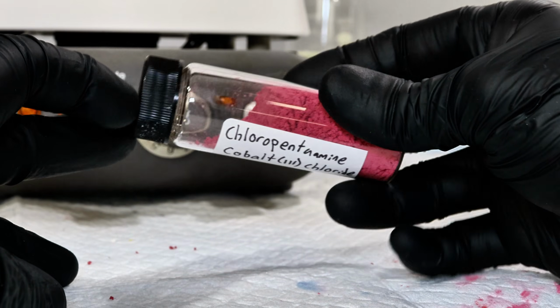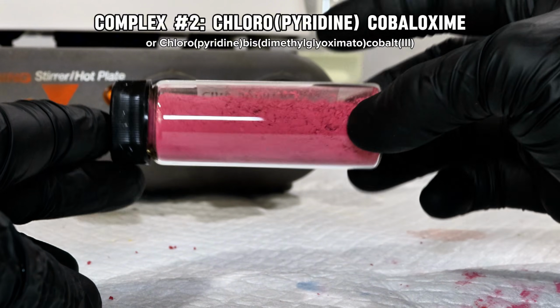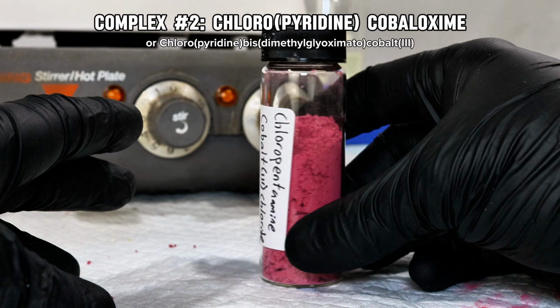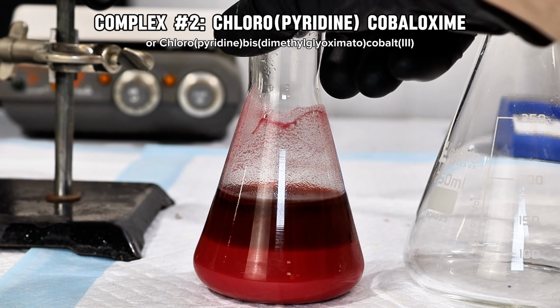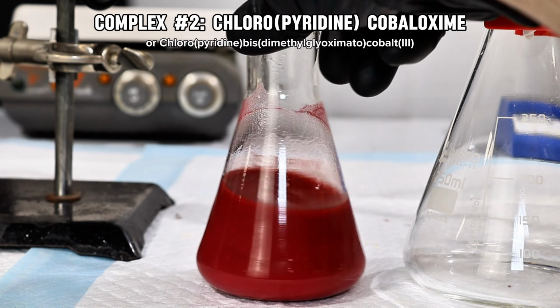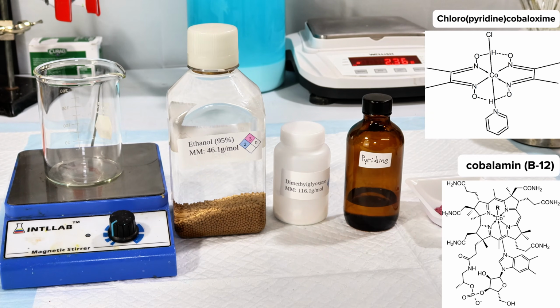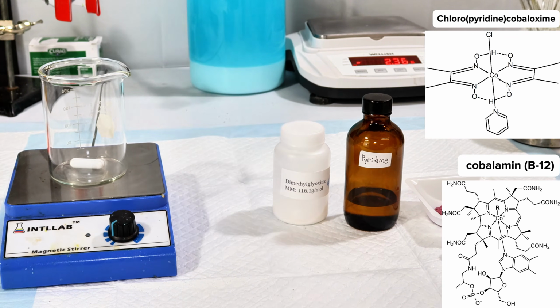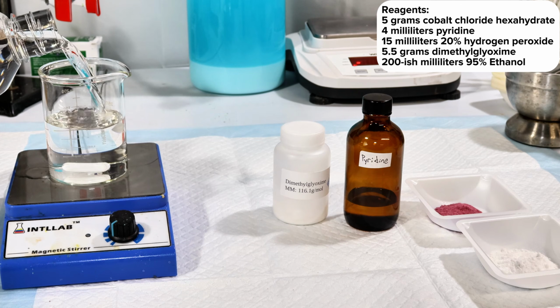Now, the second cobalt complex I'll be making today is called chloropyridine cobaloxime. This cobalt complex is a good example of how a resulting complex can be charge neutral, and will introduce a new kind of ligand. Not only this, but due to its unique structure, this chemical has been considered as a model compound for vitamin B12 for studying the properties and mechanism of action of the vitamin. As the name implies, this compound requires 3 ingredients to make: cobalt chloride, pyridine, and dimethylglyoxime.